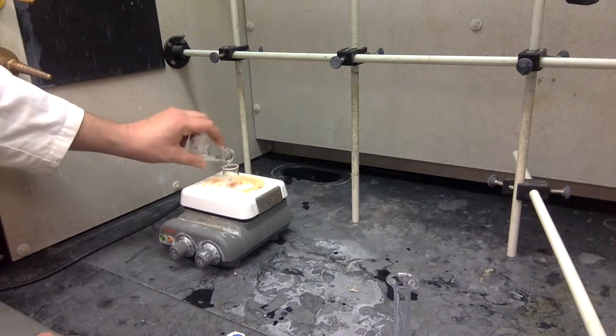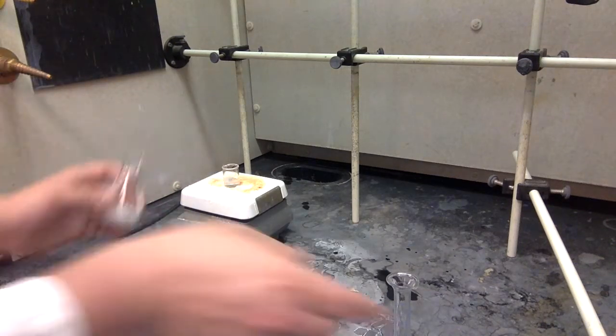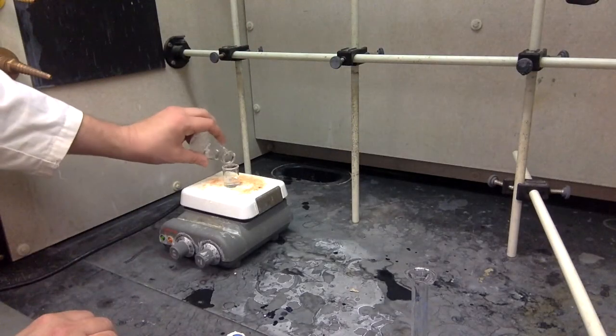Otherwise, if you have at least 40 to 50 minutes left, you can go on to the next step. Decant your dried solution to an Erlenmeyer flask. Or personally, I prefer a beaker. Just make sure there's a boiling chip. Rinse it out. Combine the wash. Just make sure you're leaving all the carbonate behind.